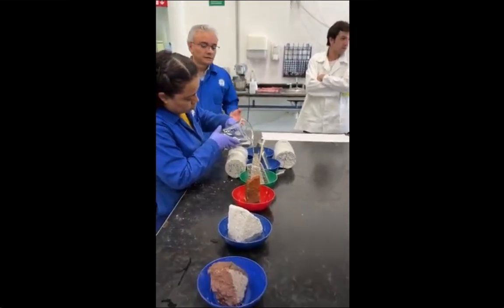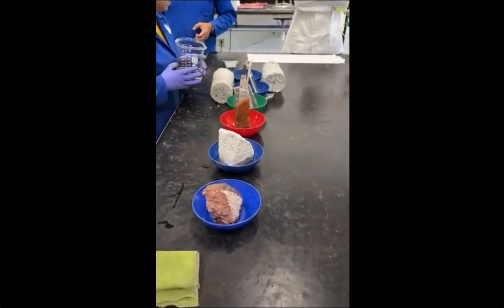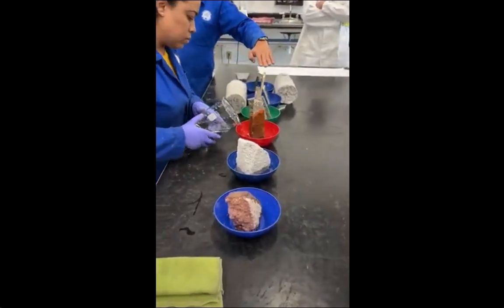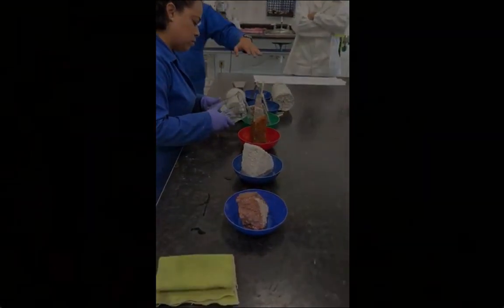After submerging the ceramic specimen in the solution, we snapped pictures to have a baseline against which to compare. Finally, 2 and 24 hours after putting the specimens in the test solution, we went back to the lab to snap more pictures. Now, for the results, there were no impressive results.